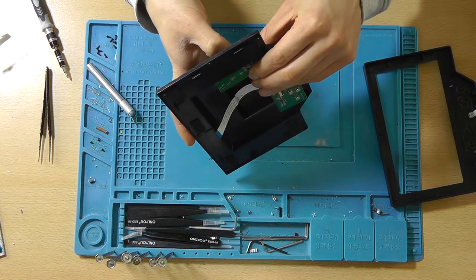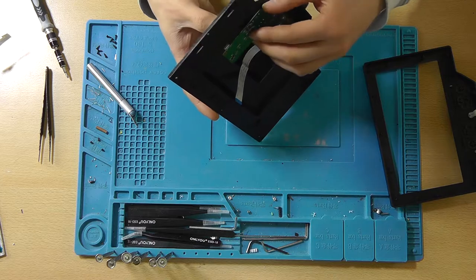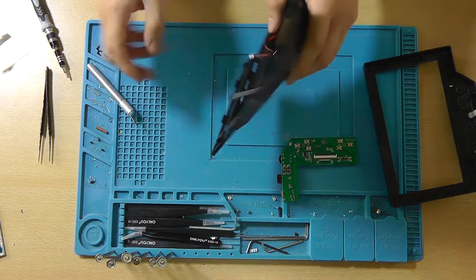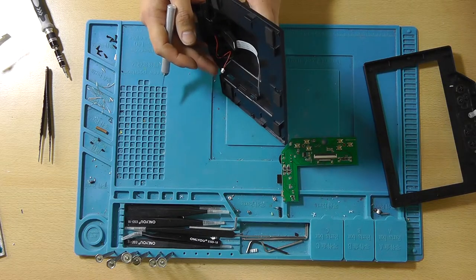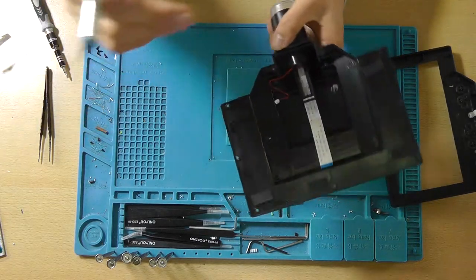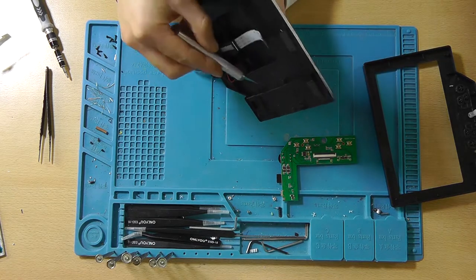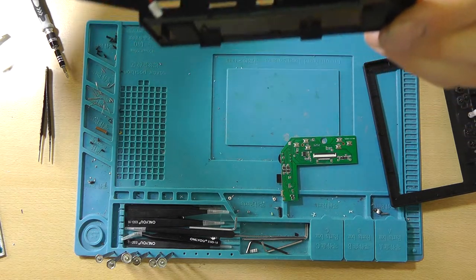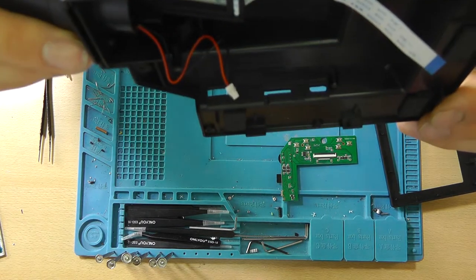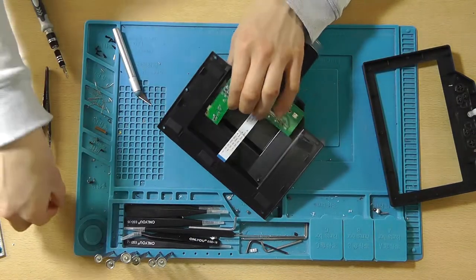So let's see. No, it's still getting caught on the... Oh wait. Aha. I cleared out the wrong hole. This is the SD card hole, the middle one. And you can clearly see the edge at which the SD card is getting stuck over here. So that seems to be working. So that's good.